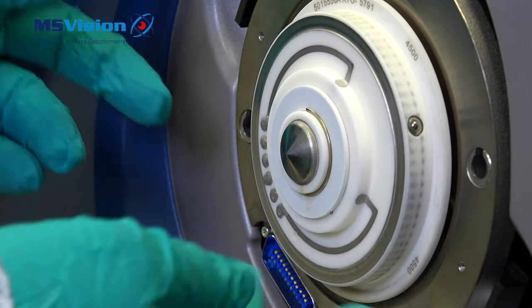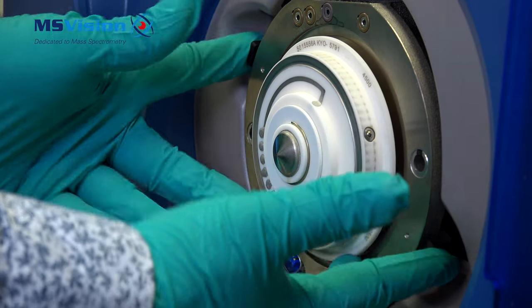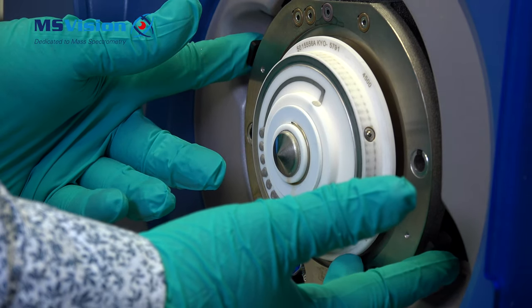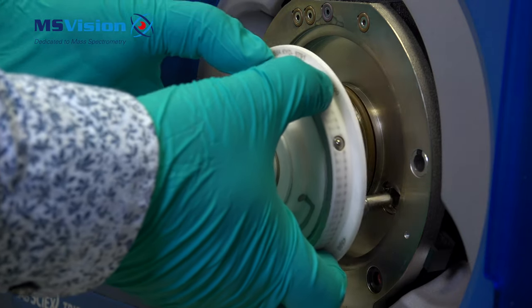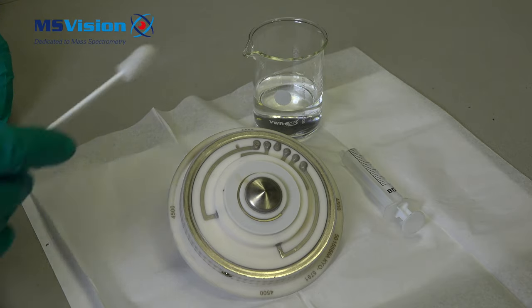To remove the orifice plate, press in the two black push-in locking pins located as shown. The orifice plate will move out a little — carefully pull away the orifice plate. Use caution as the orifice plate may still be hot and it is very fragile.